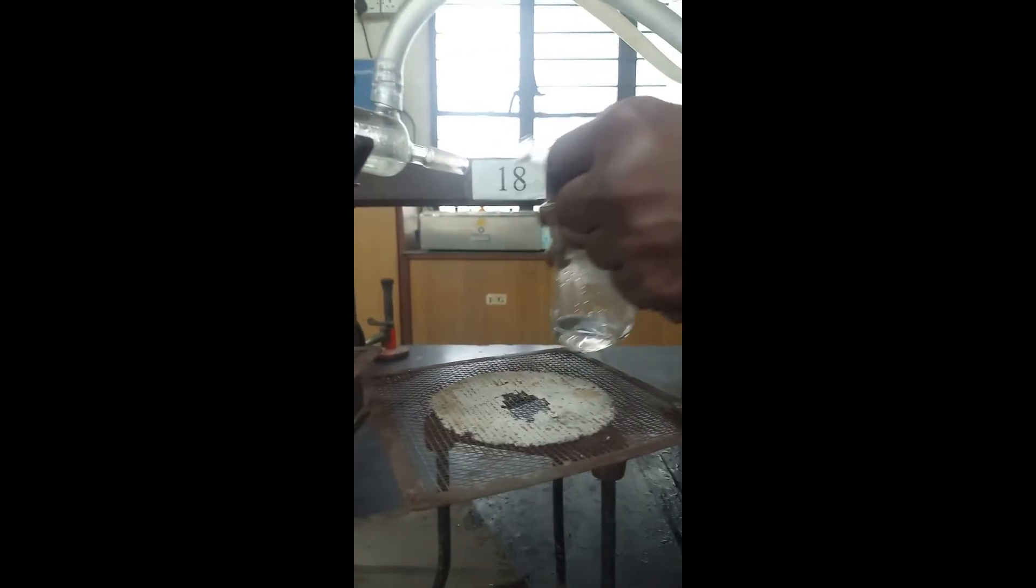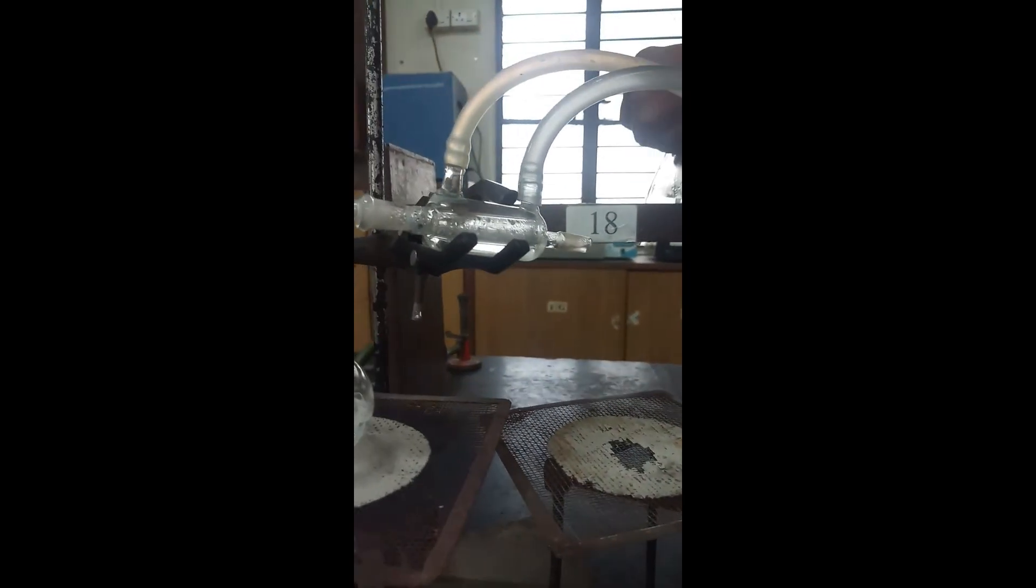Replace this receiving flask. This receiving flask is containing pure component, that is acetone.